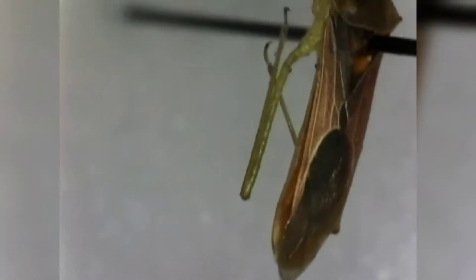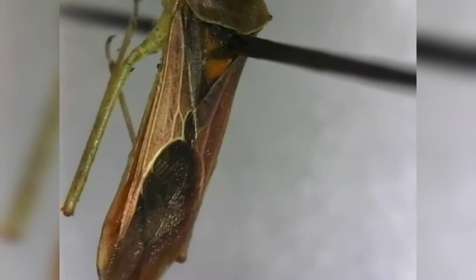Number 12 asks if the front wings have numerous tiny crossbars giving a lace-like appearance. Getting this in focus — you can see this is definitely not a lace-like appearance, and it's definitely more than five millimeters in length. So we move on to couplet 14, which asks whether ocelli are present or absent.